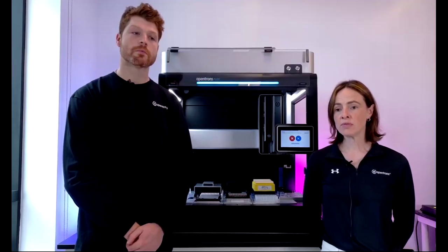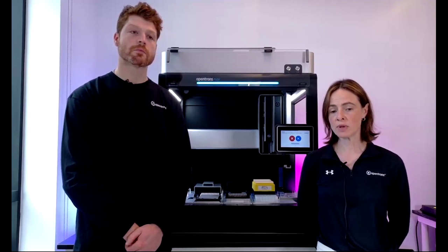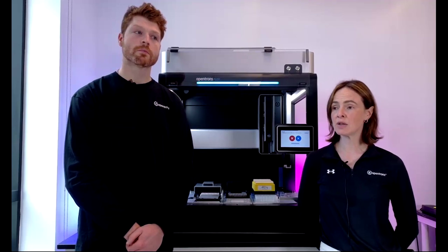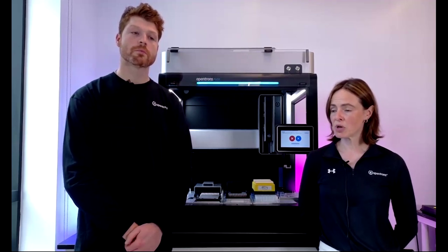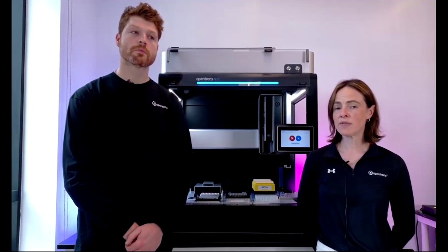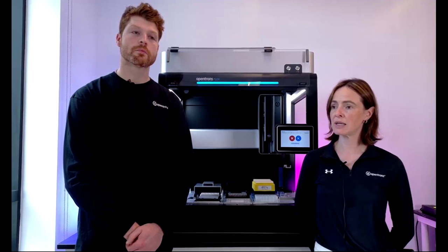Okay, Flavio, has this robot been deployed to applications beyond pharma or medical, i.e. chemicals? Thinking of pipetting viscous or even weighted solid materials. Yeah, we have a real long tail of applications, I would say. While the person who asked the question is right that our dominant fields are really molecular biology, genomics, proteomics, we do have a lot of inorganic and organic chemistry, materials handling customers.